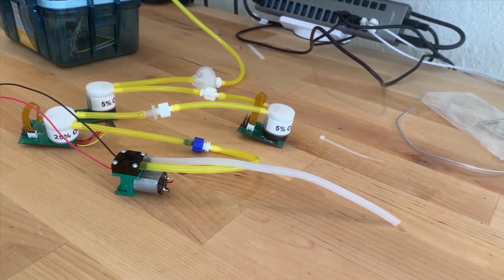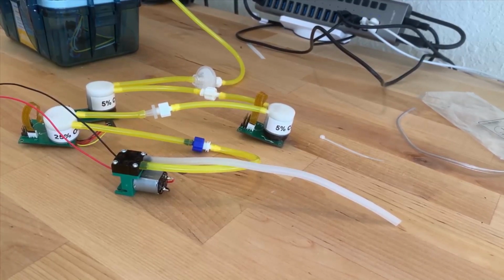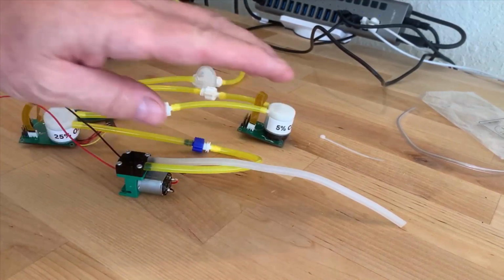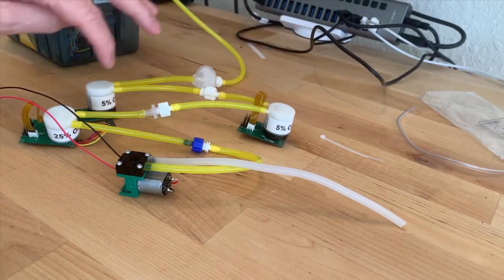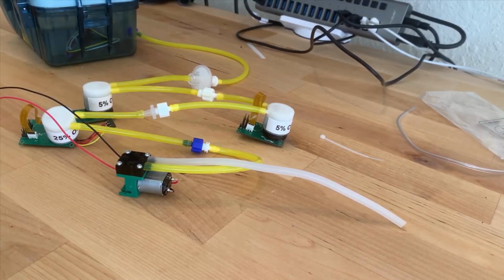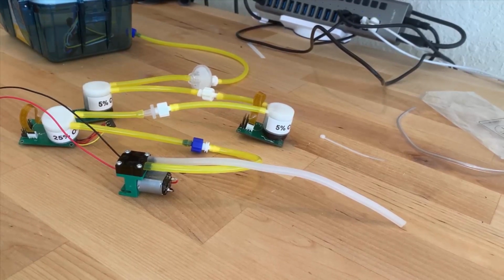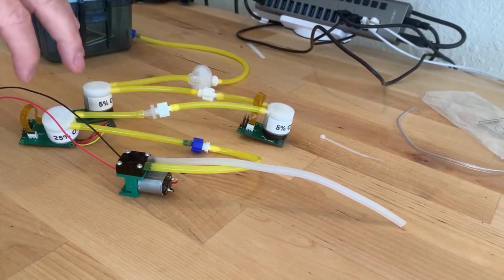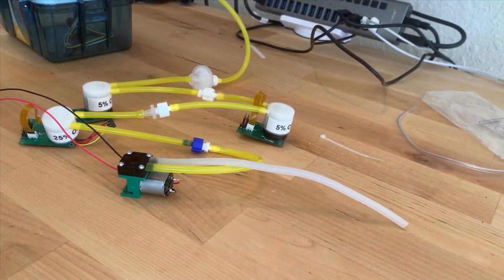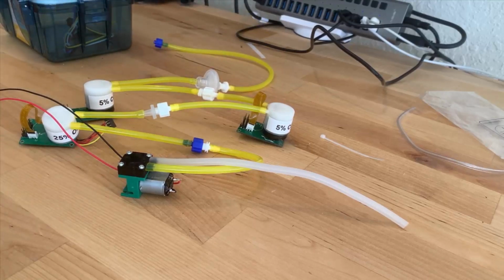Okay, what we're going to attempt today is just give you an illustration of hooking up multiple sensors via a pump for sampling. We've got a little box over here that we could be sampling from. But what we've done is we have a pump sucking on these three sensors. The input is coming in here, and there's a little filter in there just to keep dust and any other crud out, you never know. It flows into this 5%, this 5%, this oxygen sensor, through the pump, and out it goes. You can see it, or you can actually sort of hear it operate. When I restrict it, the pump has to work a little bit harder.